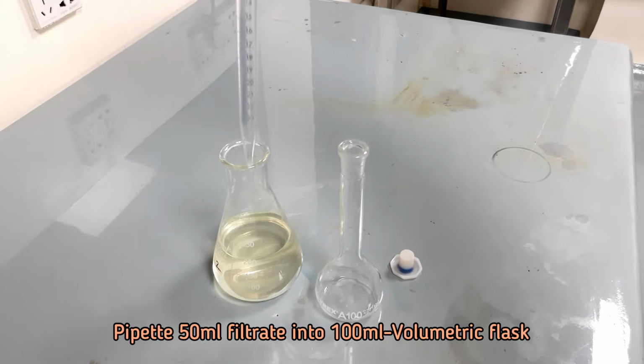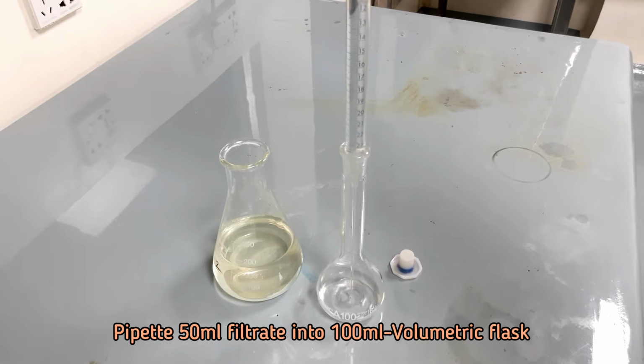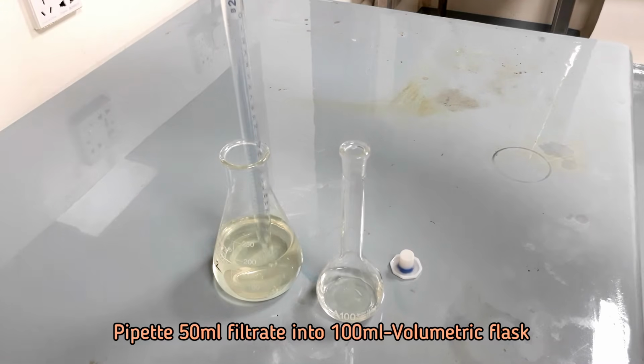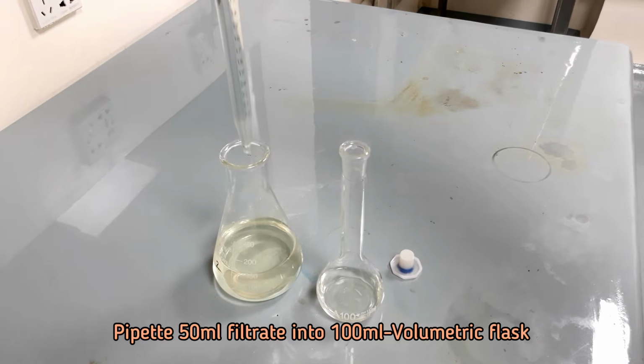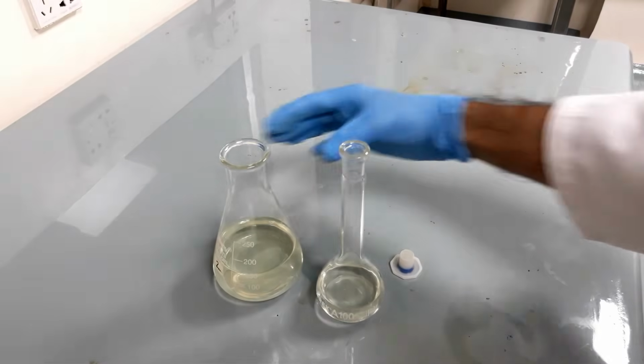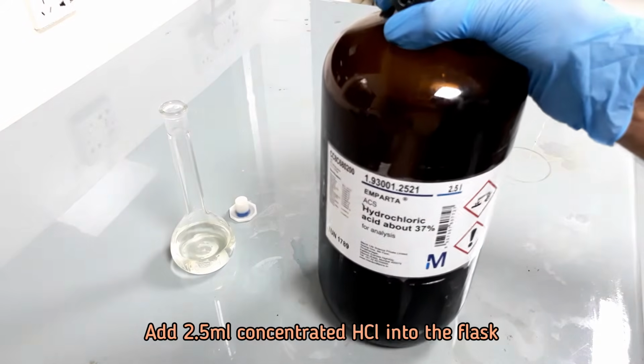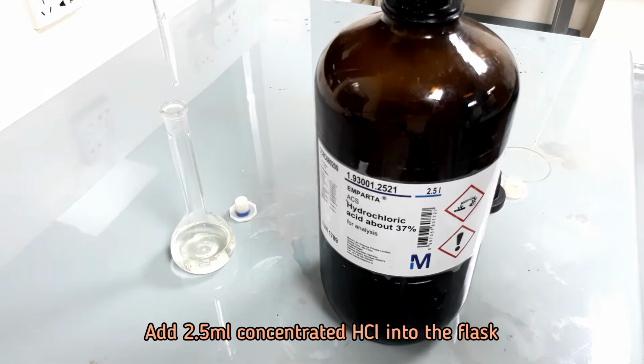Pipette 50 ml filtrate into 100 ml volumetric flask. Add 2.5 ml concentrated hydrochloric acid and let stand for 24 hours.